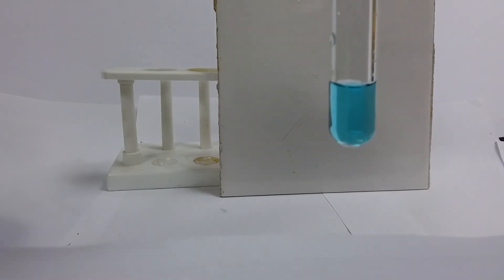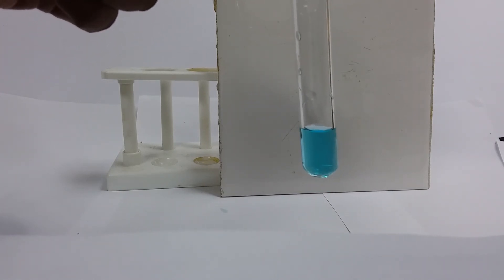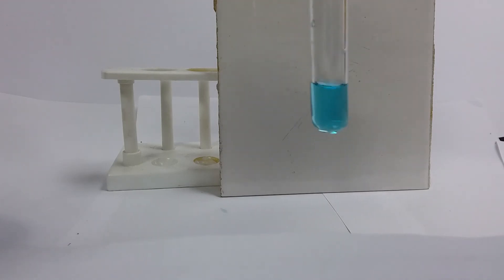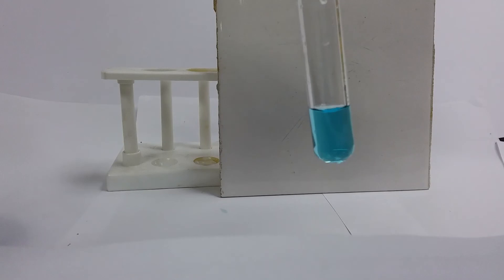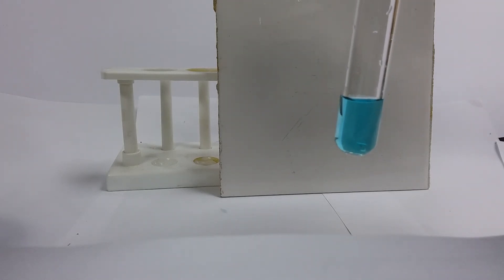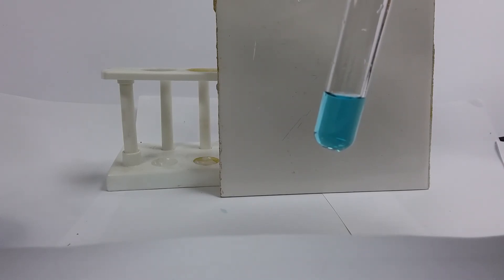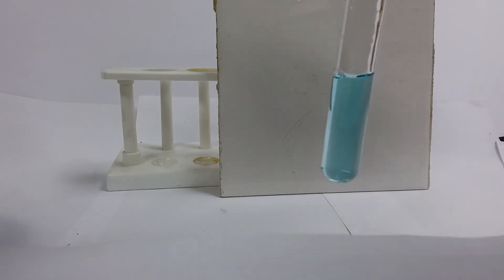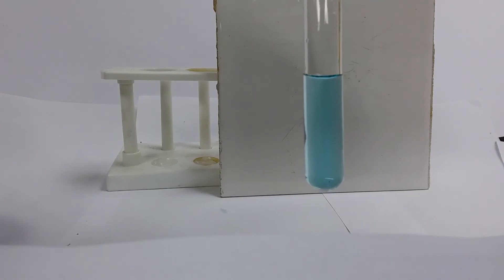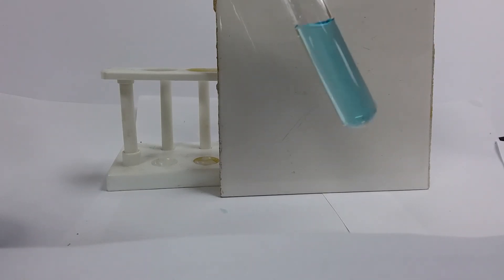Now we're looking for our anions. It's not so obvious what the anion would be here, but it is certainly one that will form a soluble salt with the cation — because again, we have a solution. My first test for the anions is silver nitrate. Just remind me: what are we looking for when we add silver nitrate? What type of anions? I'm adding silver nitrate — just a little bit. And what do I see? Does this follow any of the expected observations? How would we record this observation?